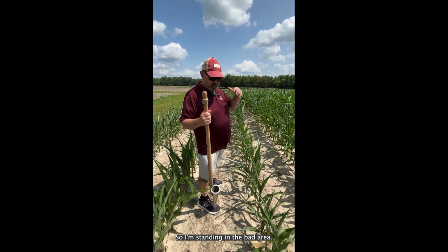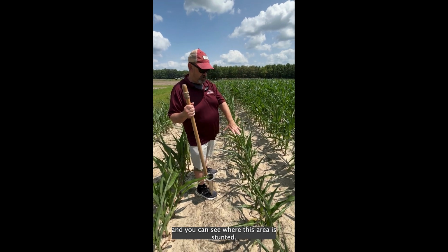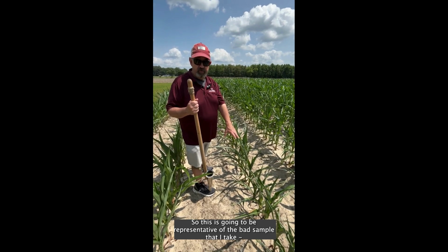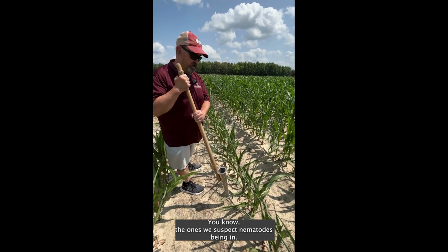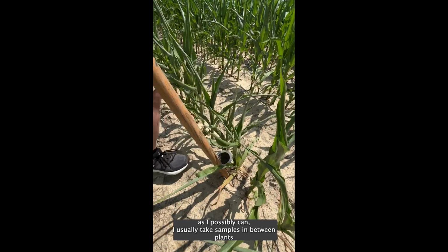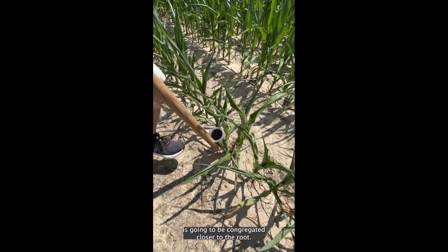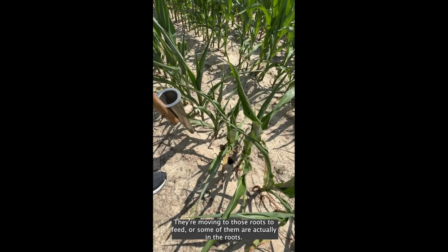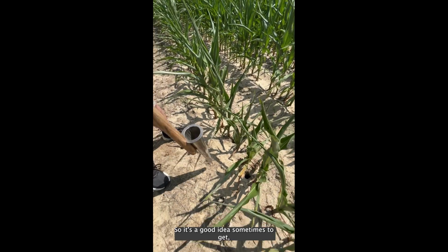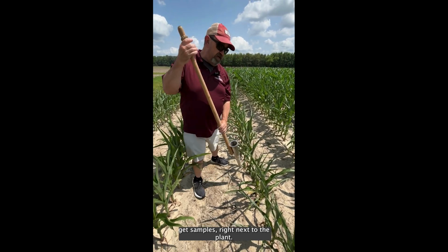So I'm standing in the bad area. You've had a look at the normal corn, and you can see where this area is stunted. So this is going to be representative of the bad sample that I take, the ones we suspect nematodes of being in. Where I want to take my sample is as close to the plants as I possibly can. I usually take samples in between plants so I can get some of the root, because the nematodes are going to be congregated closer to the root. They're moving to those roots to feed, or some of them are actually in the root. So it's a good idea sometimes to get samples right next to the plant.